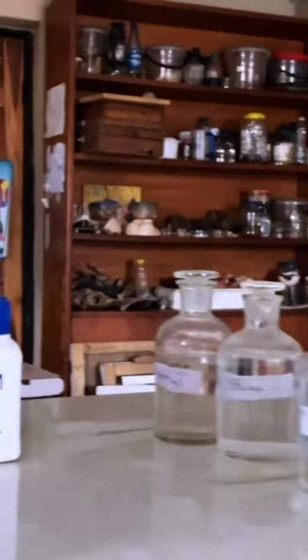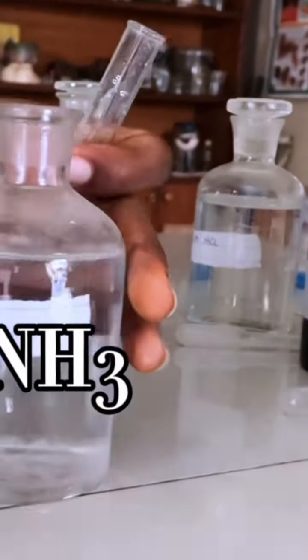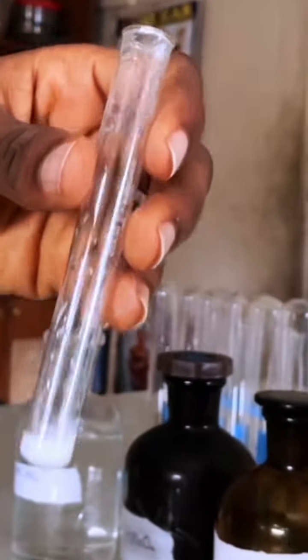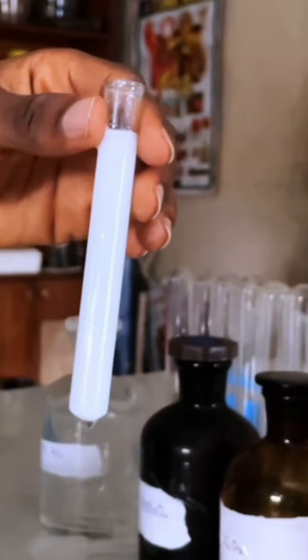I'll take another portion too. You're asked to take a little other portion. I'll take another portion here. So I'll take very little. So this is ammonia. I'll pick very little of it in drops. You can still see a white chalky PPT was formed. Then in excess, even till full, you can see that the white PPT persisted.